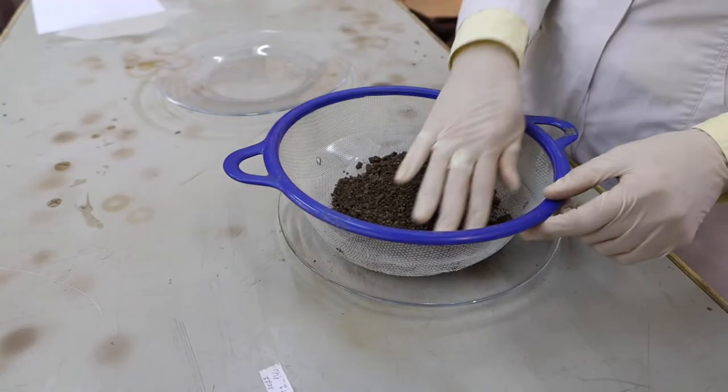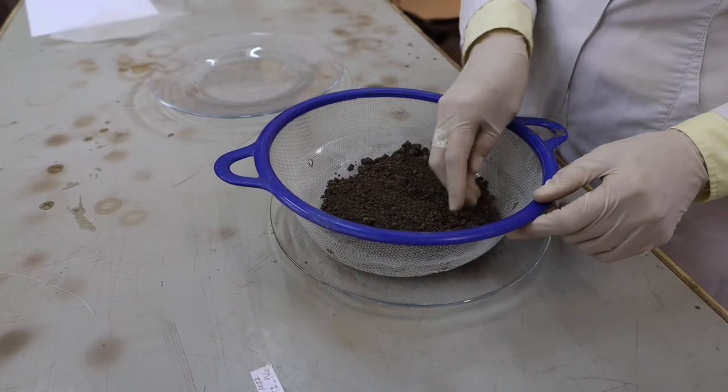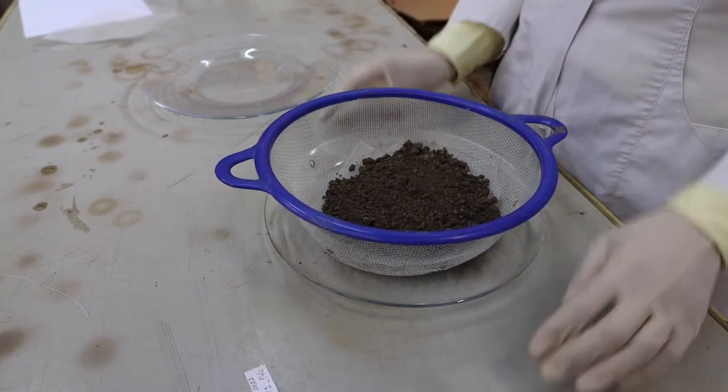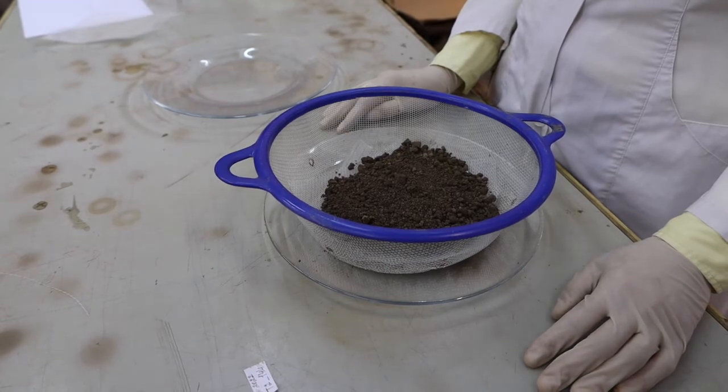We check if the substrate is dry above the table and never above the funnel. Overall, avoid any disturbance that makes dirt fall down into the ethanol. Clean extraction is very important.